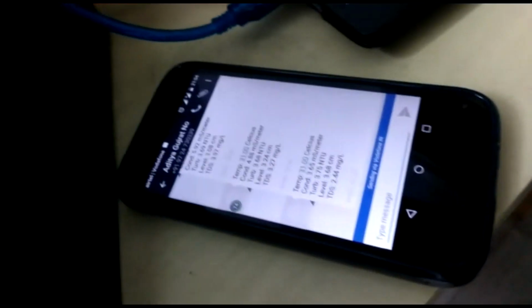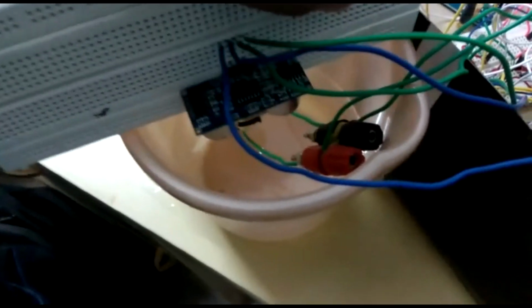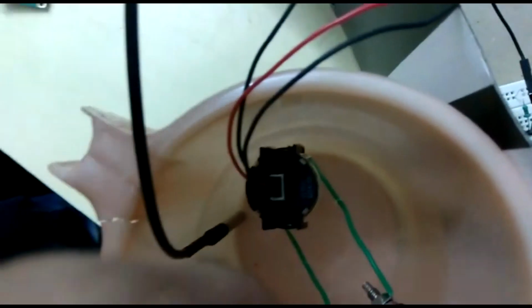And again the circuit here, with the Arduino, the main circuit, the LCD circuit here, and this is the GSM module along with the SIM card. Here we have a water solution with two of the sensors, the visible conductivity sensor and the ultrasonic sensor. And over this side we have two more sensors. This is the temperature sensor, and the other one is the turbidity sensor. So yeah, again LCD and the message. Thank you.